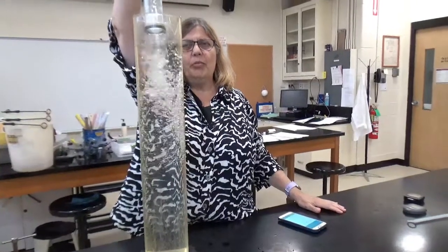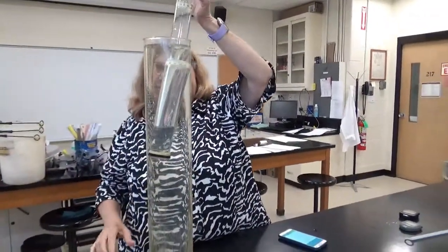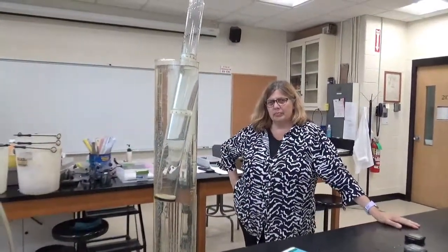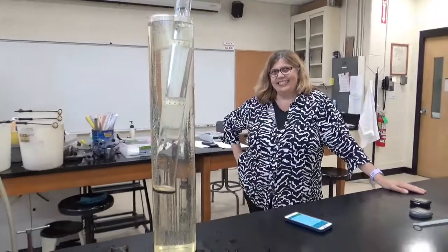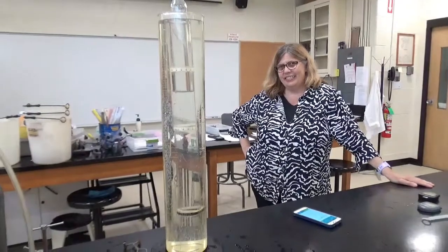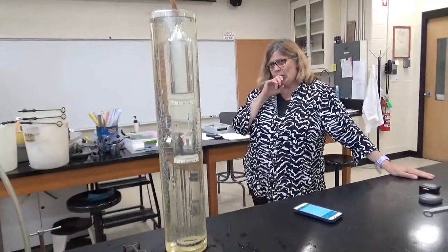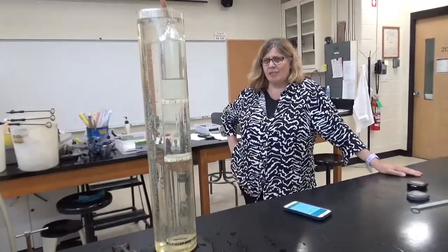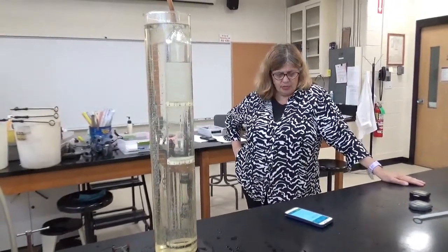Actually, flush it with air once because it makes sure all the natural gas is out of there. I'm sure it is, but what the heck. So we're filling the tube with water, so we're flushing out anything that happens to be in there. So hopefully there is nothing but water in this tube. Then we'll do our experiment again. So we're just flushing this time, and next time we're going to do air.